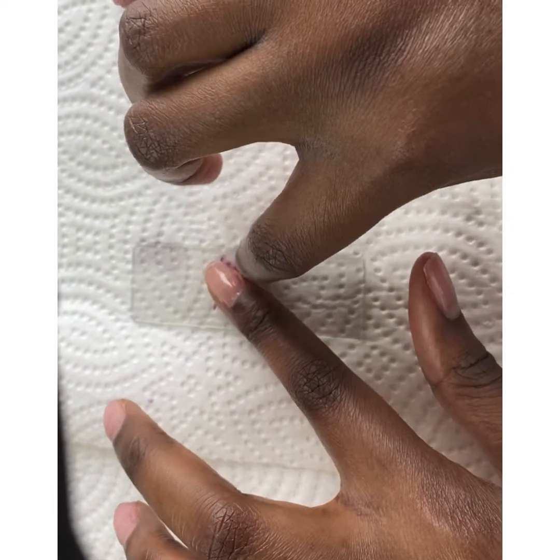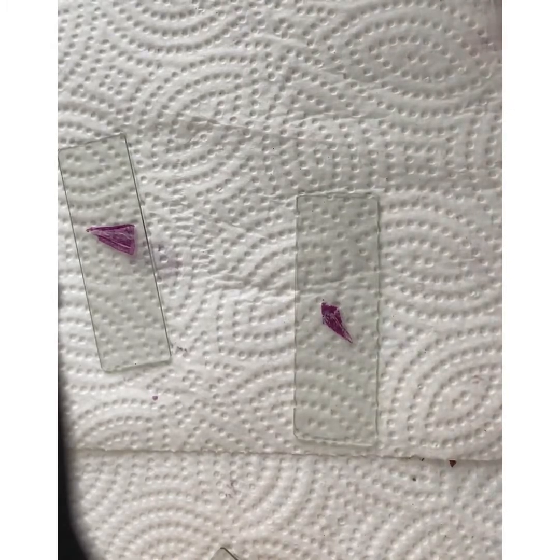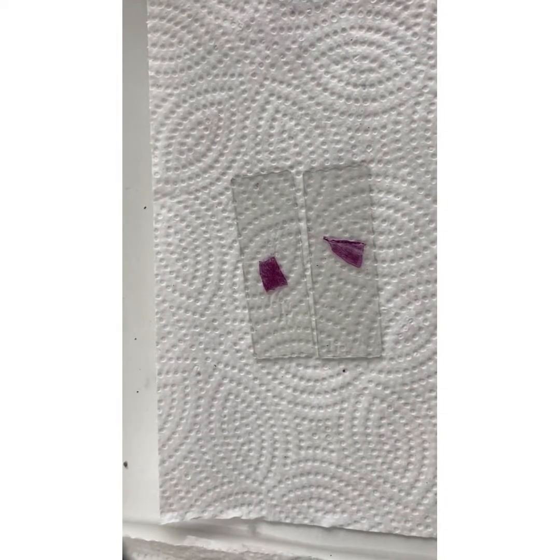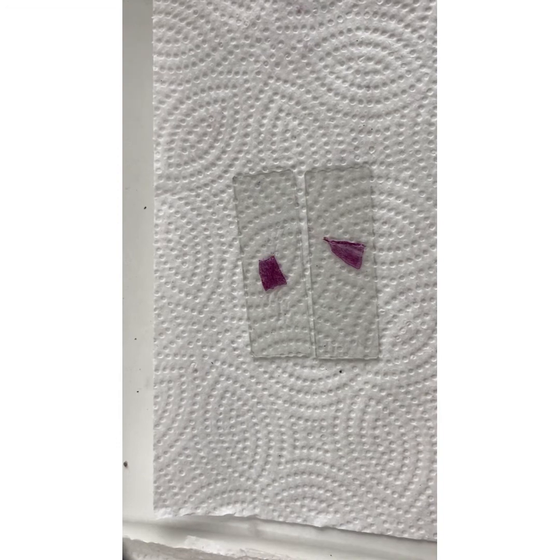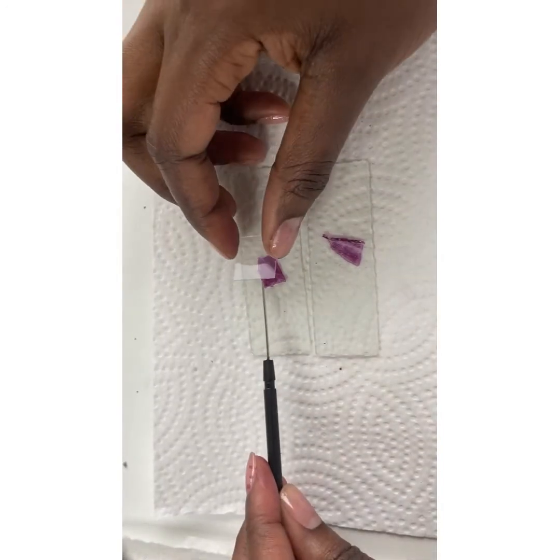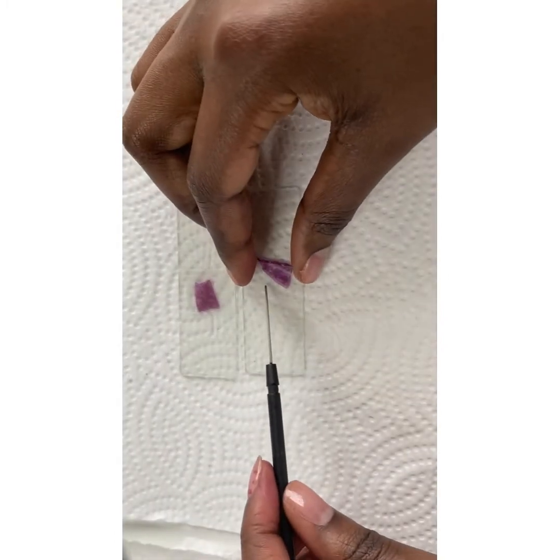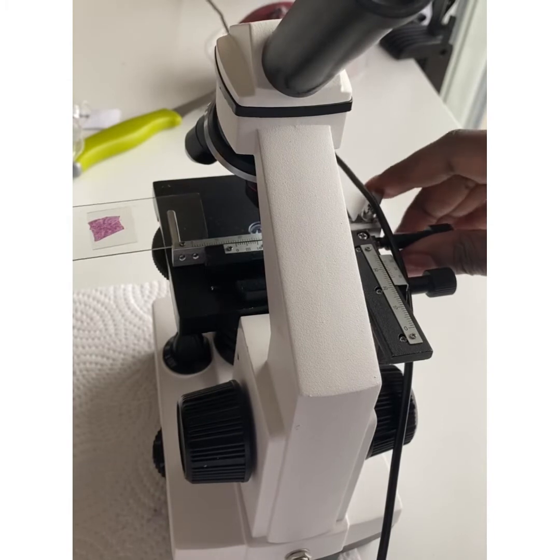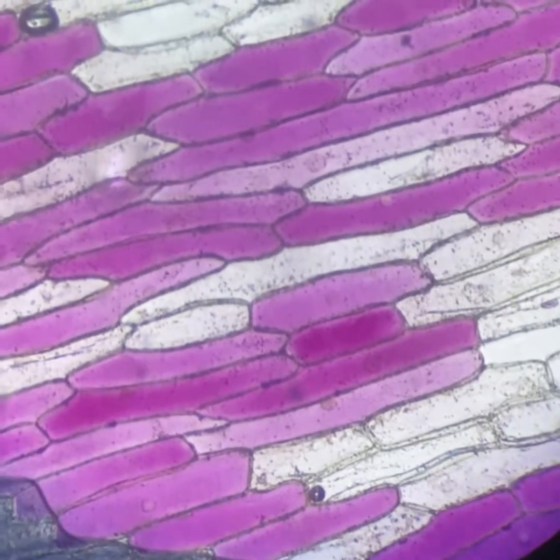Next, I'm going to place the piece of epidermal tissue on a microscope slide, and then we're going to view what normal red onion cells appear to be under normal conditions before we start plasmolysing the cells. Here you are seeing normal red onion cells. Look at how the cells are arranged before plasmolysis.